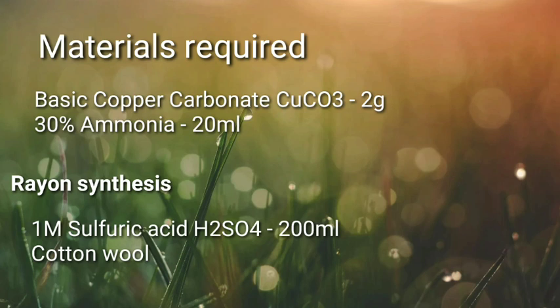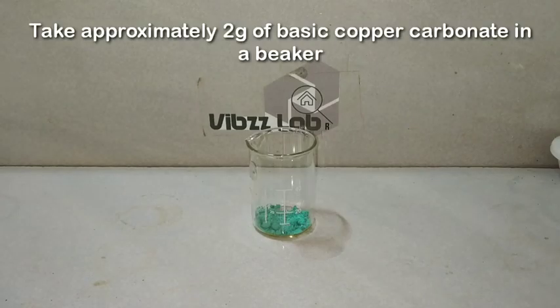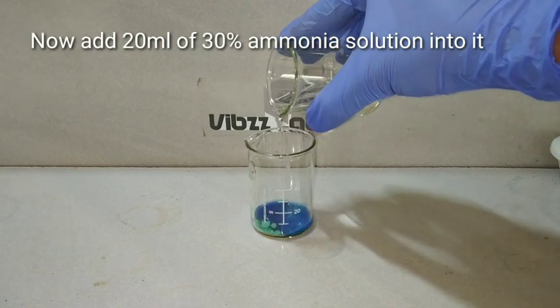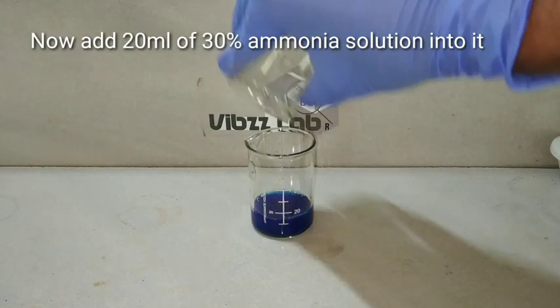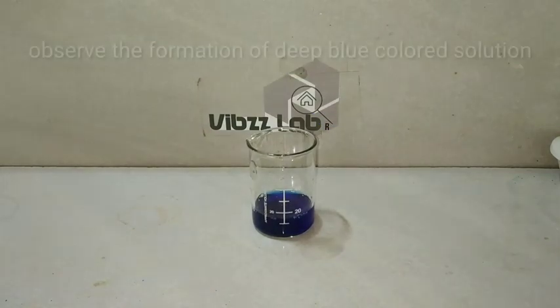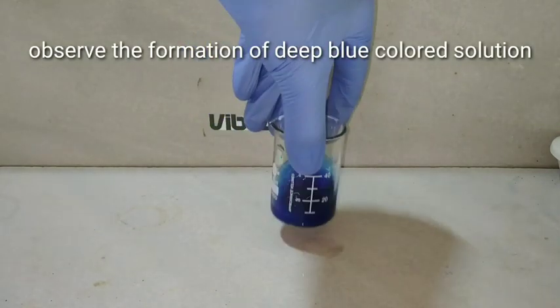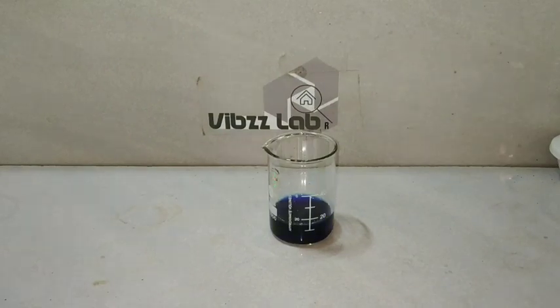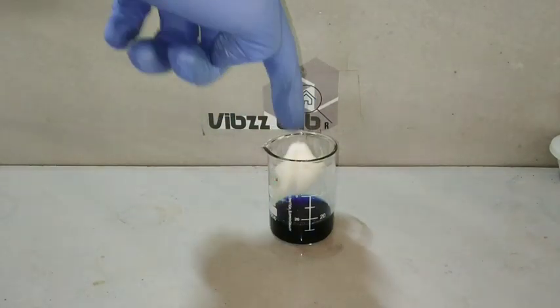For this experiment, we require 2 grams of copper carbonate, 20 milliliters of 30% ammonia and 200 milliliters of 1 molar sulfuric acid. First of all, we have taken 2 grams of basic copper carbonate in this beaker and now we are adding 20 milliliters of 30% ammonia solution. You can observe the formation of a deep blue colored solution and the copper carbonate has dissolved in it.